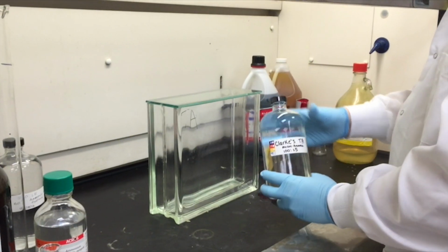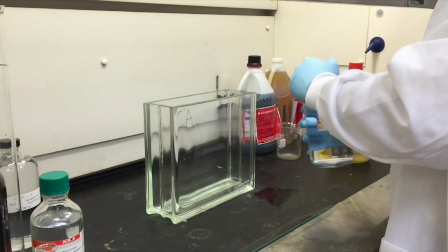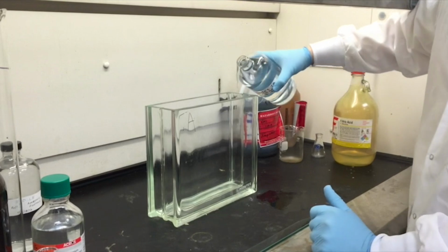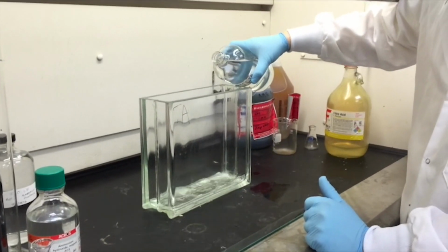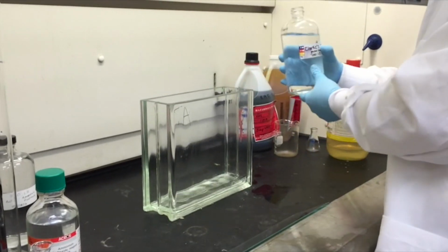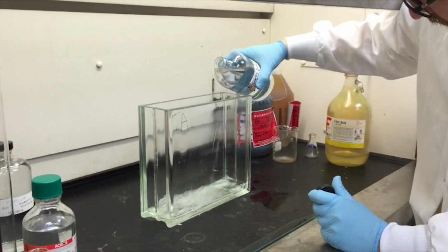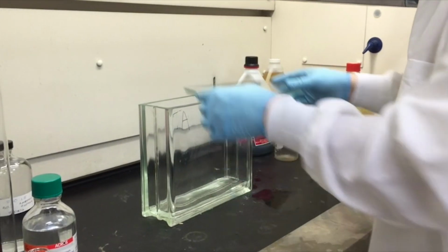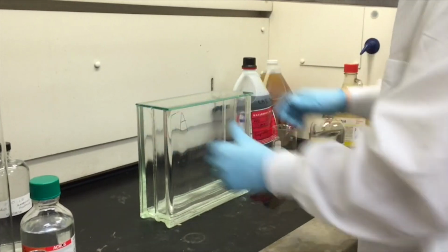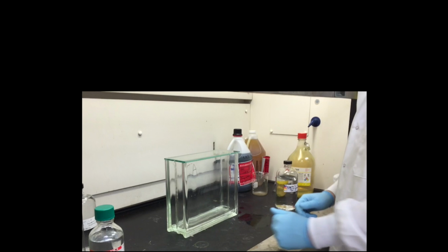On any day that you think you might be doing TLC, I encourage you to, first thing when you come into lab, get your chamber set up. This means have your chamber ready and clean, and pour in whatever mobile phase you're going to use for the experiment. You need this chamber saturated, and that can often take 30 minutes, and you need it saturated before you run your plate. It's nice to have that done when your plate's all ready. So if you just start it as soon as you get into lab, by the time you're ready to run your plate, it's all set up.